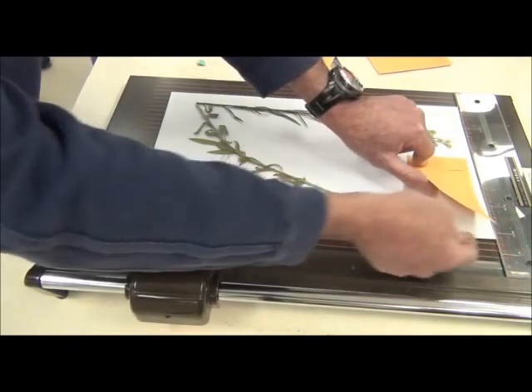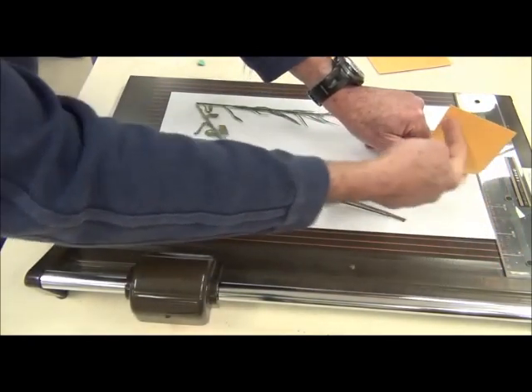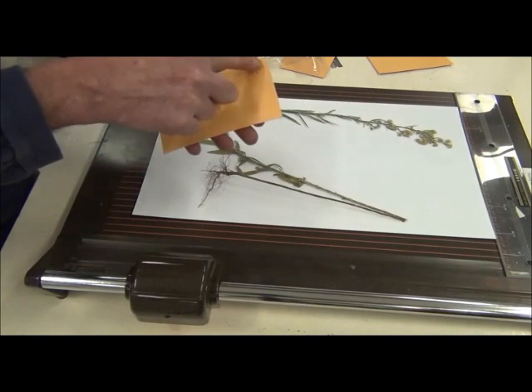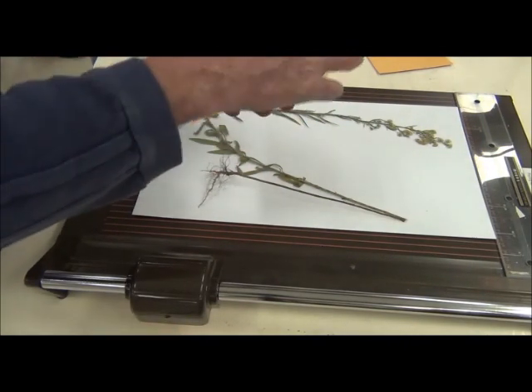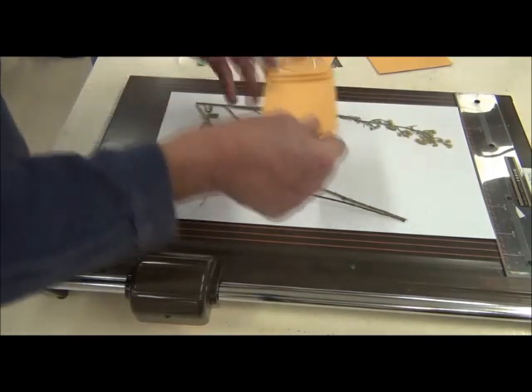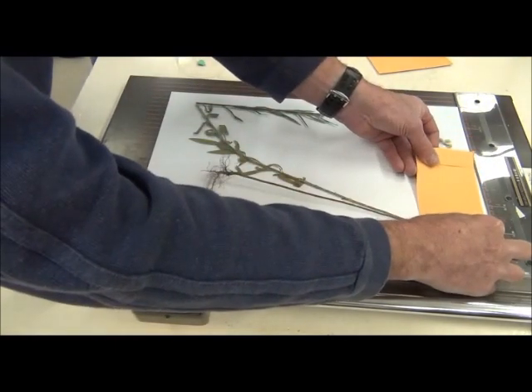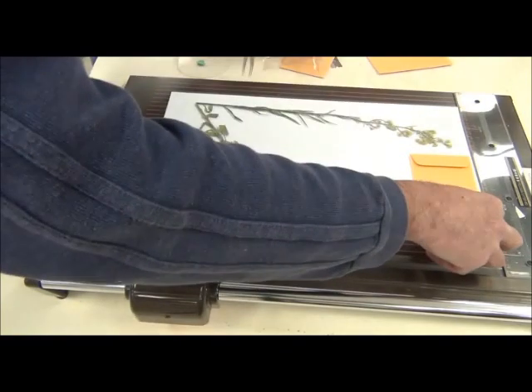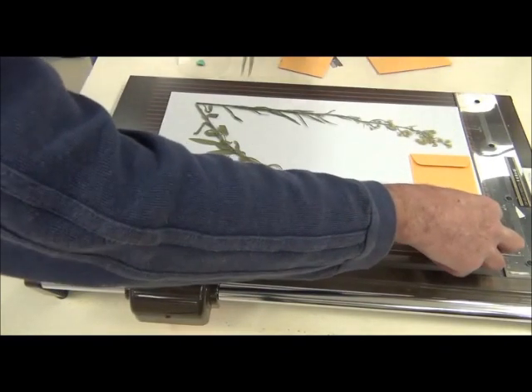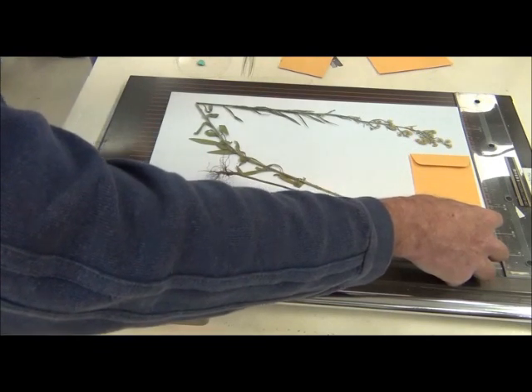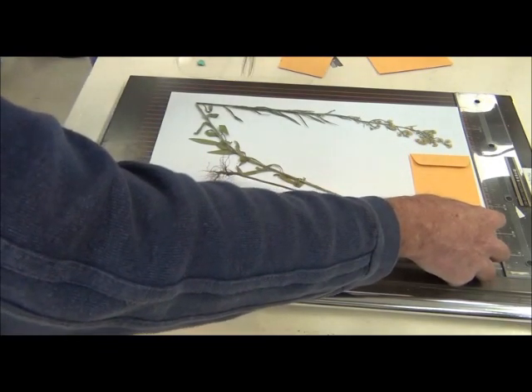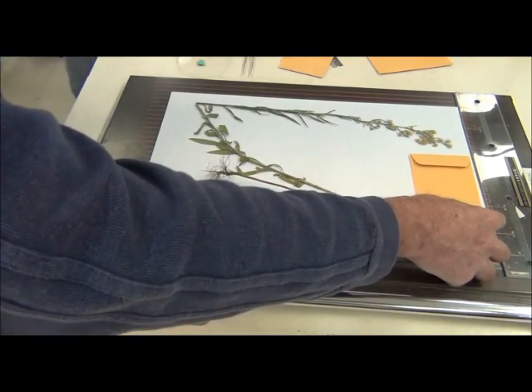And I'm going to glue in there. So I would grab the glue stick and I would put glue like so, so that the bottom third or quarter sticks down. I then place that down and then I can slip in the cellophane bag which has the bits and pieces plus the tag or the label with my initials, last name and collector's number.